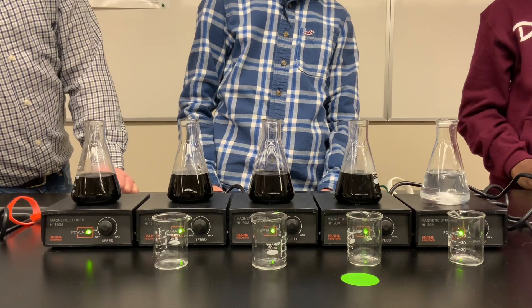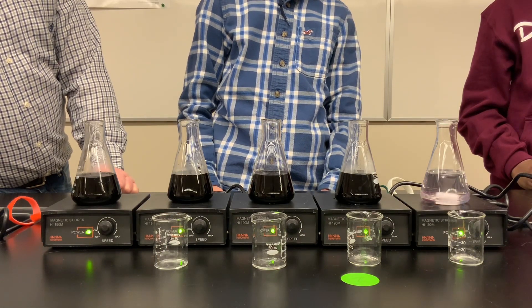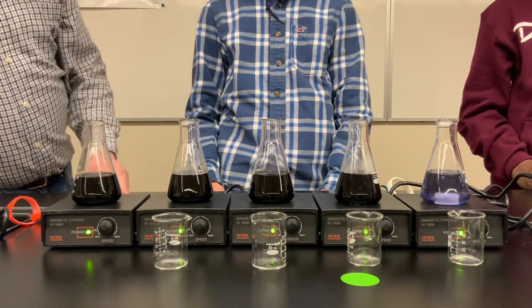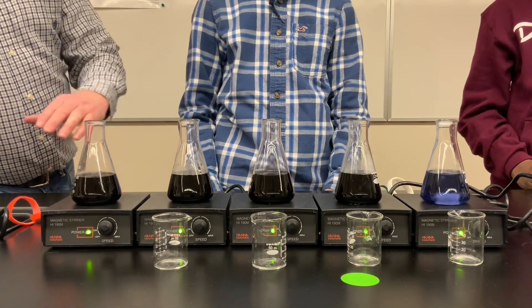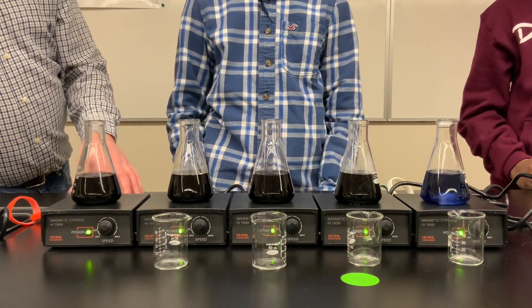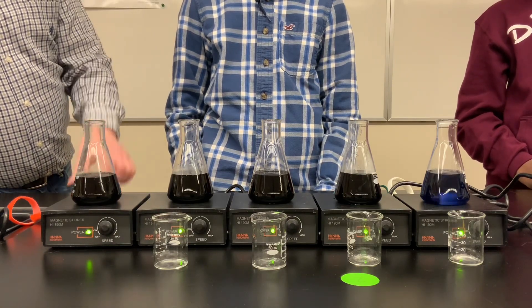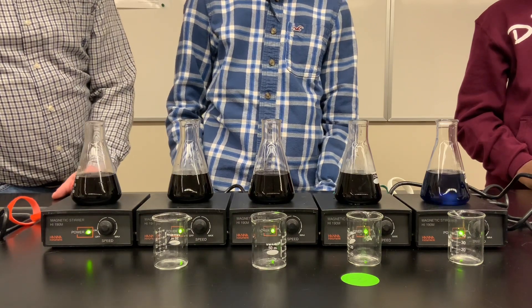There we go — it just changed color. It's a much less intense blue-black, partly because it's less concentrated. So there you have it: trial one of the iodine clock reaction. We've just diluted the bisulfite. We're going to reset and do the same thing, but this time changing the potassium iodate concentration.